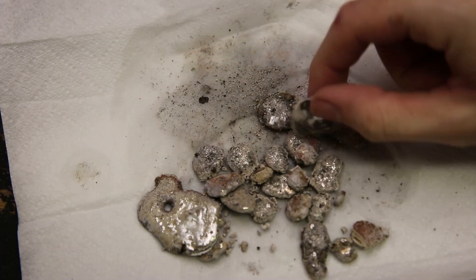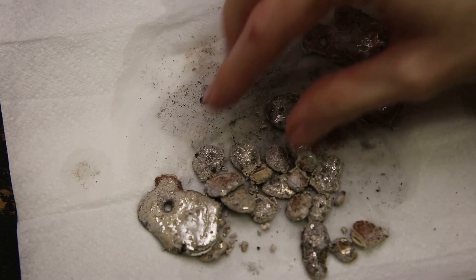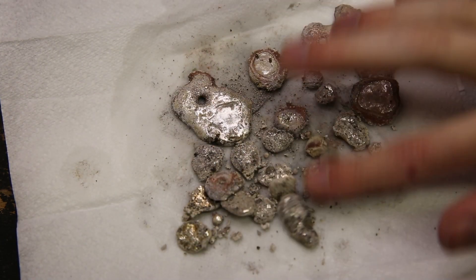And this is what I got. There are some shiny pieces, but most of them are pretty dirty, so I'll go and clean them up.